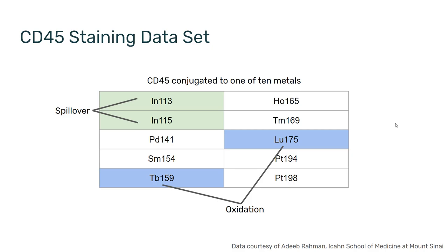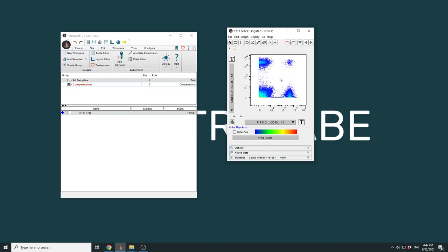Looking at these masses, there are two potential sources for spillover in this dataset. One between 113 and 115, which are adjacent in their mass, and the second between 159 and 175 due to oxidation. You will notice that there is a 16 mass difference between these two. So let's load this data into FlowJo.